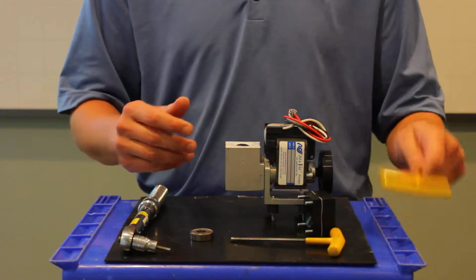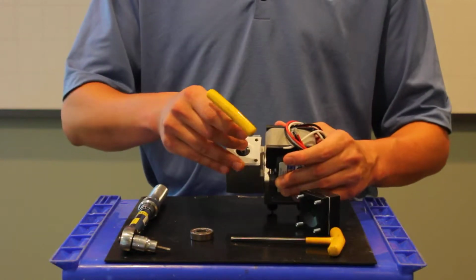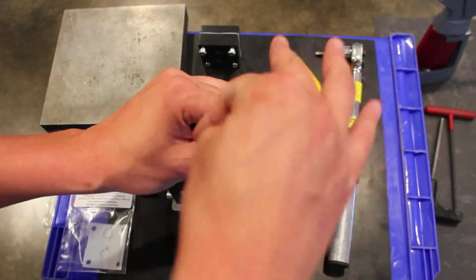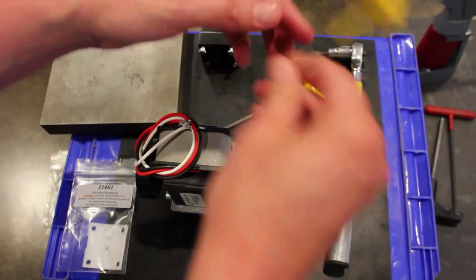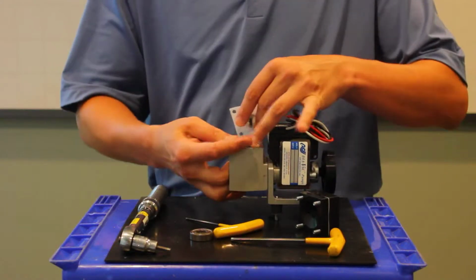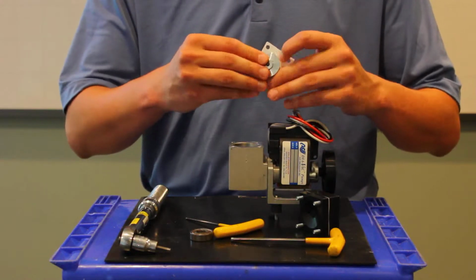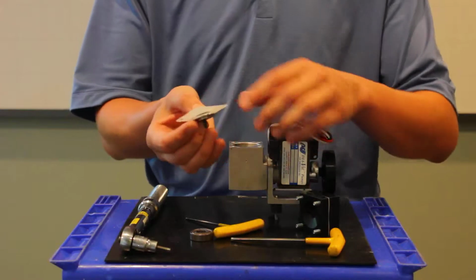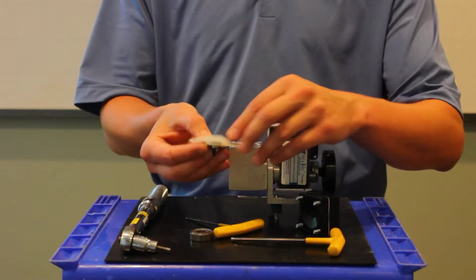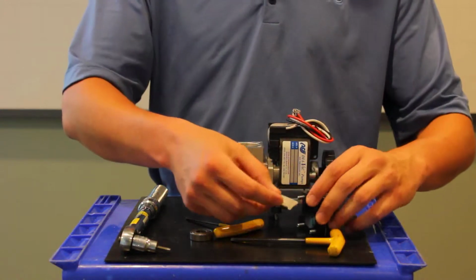So then what we'll do is we'll grab our 3/32 Allen key, and we'll go ahead and remove the diaphragm plate screw. And then we'll pull off the diaphragm. And this part underneath here is what we call the connecting rod cap. And that's what normally fits right underneath there. So what I call this, which is the diaphragm screw, the plate, the Teflon washer, the diaphragm, and the cap, I call it the diaphragm assembly. So we'll go ahead and put that over here.